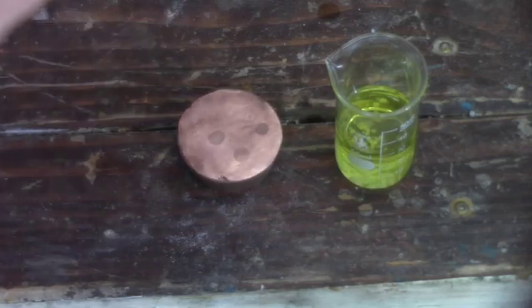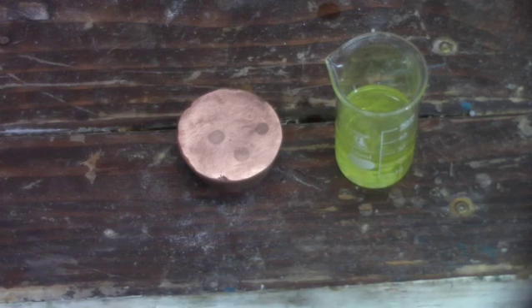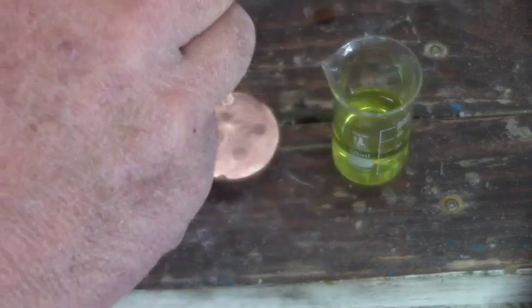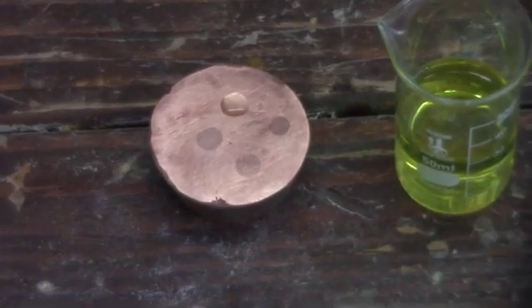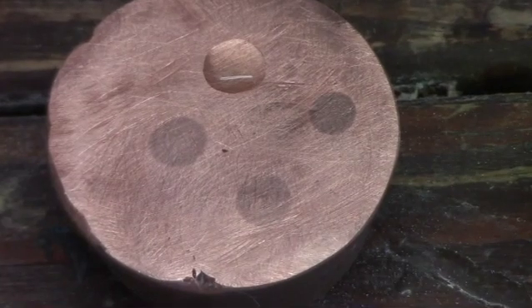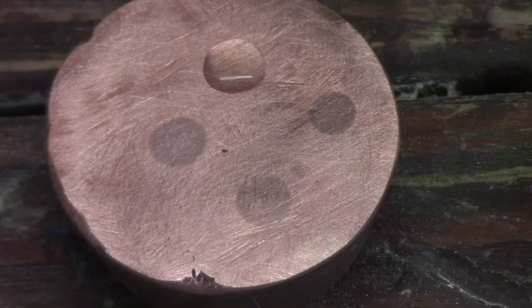Here's the addition of our urea prills on our second denoxing — we'll give those a moment to dissolve. We'll now take another drip sample and put it at 12 o'clock on our copper and see what we get. I'm seeing green, which means we still have too much nitric acid. We'll have to run another denox procedure and hopefully we hit it then.